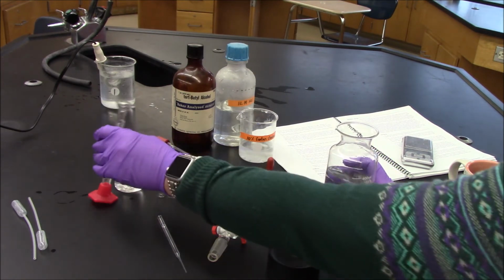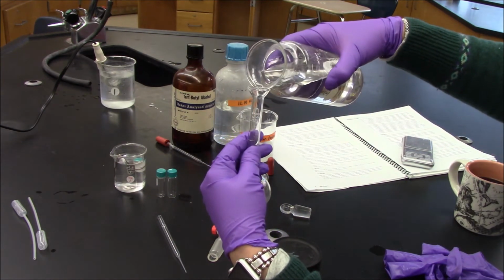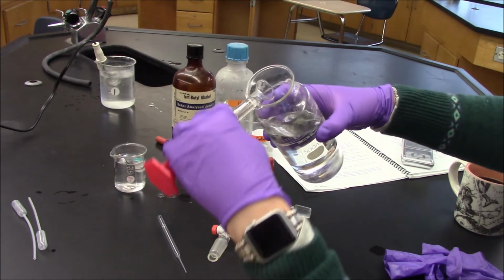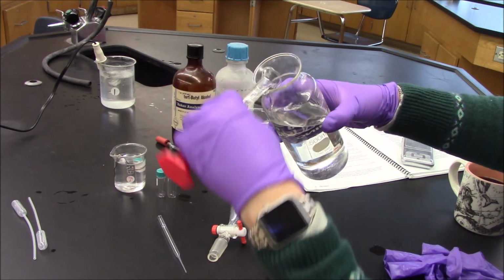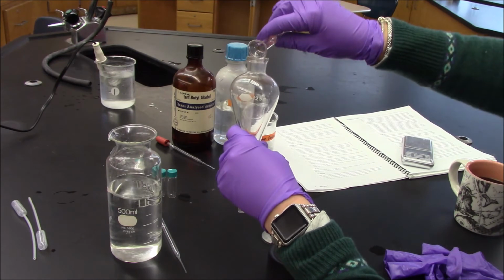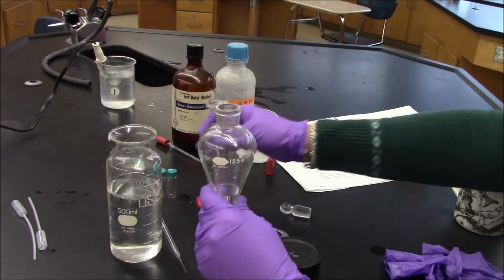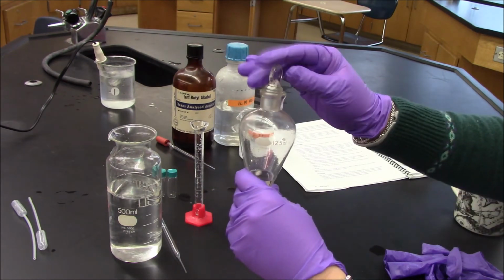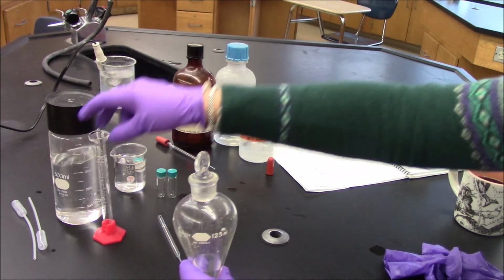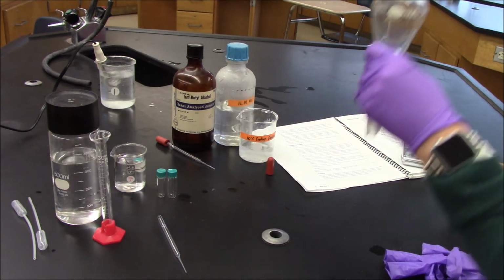Okay, so here we go. Add 10. Really doesn't matter. Okay, so I have 10 mils. Put this off to the side. And I think I'm going to find something that I can sit this in.